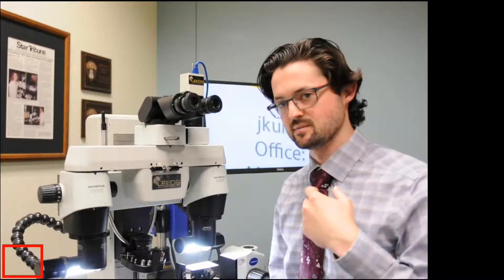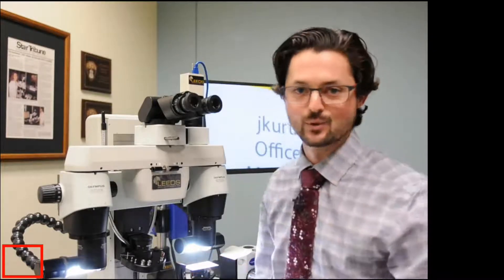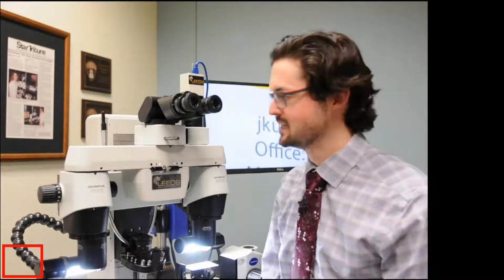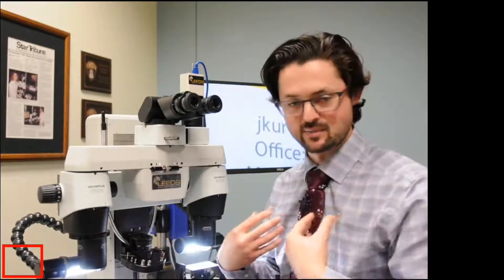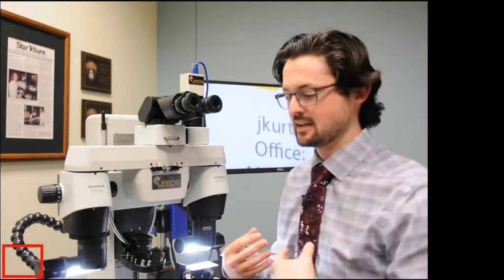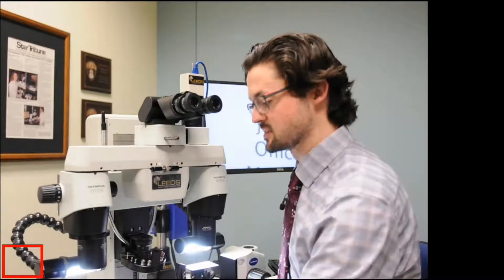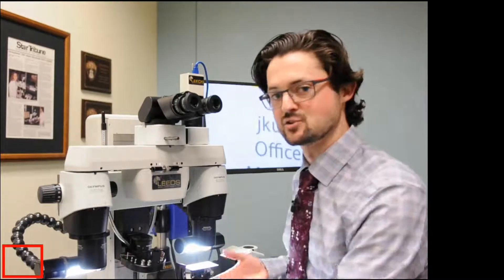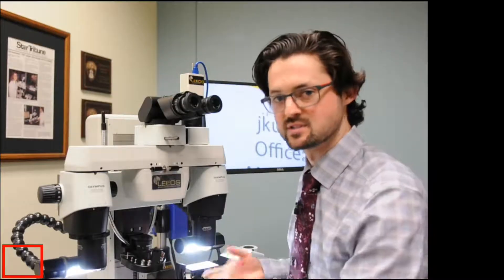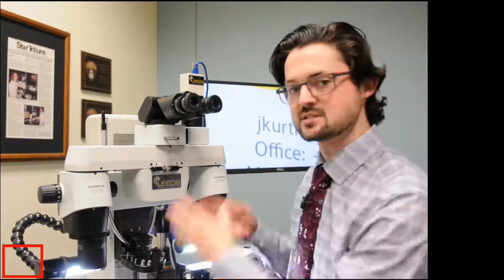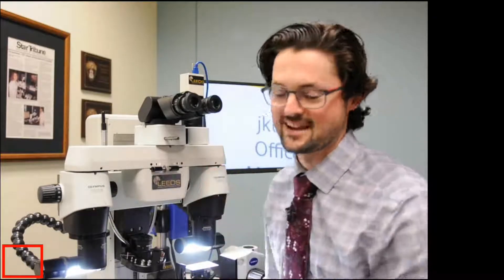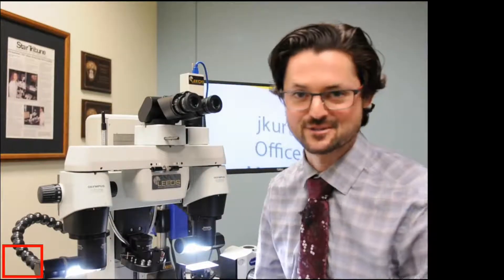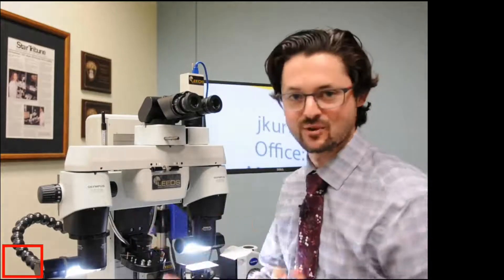So, for example, if one of my colleagues, Kevin Aboulet, for example, was on the microscope, he would have wildly different diopter numbers than my diopter numbers, potentially. And so when he'd be looking at something and say, oh, hey, I found a potential match. I'd like to bring you over and have your input to see it. If I were to use his diopter numbers and just stand at the microscope, I could think Kevin doesn't know how to focus his microscope. And so I'd have to spend time refocusing.